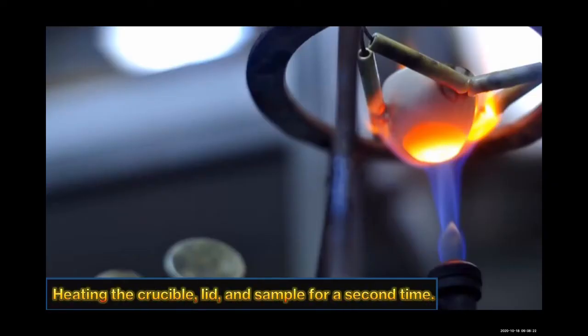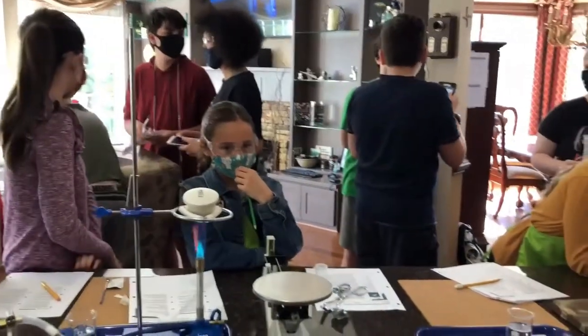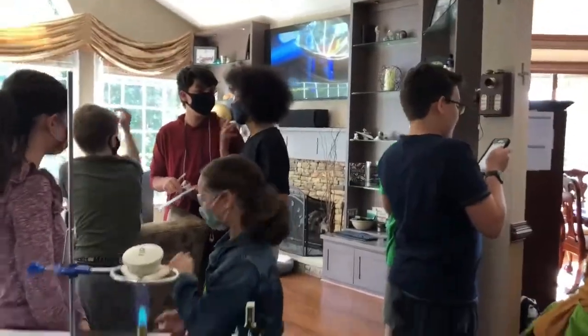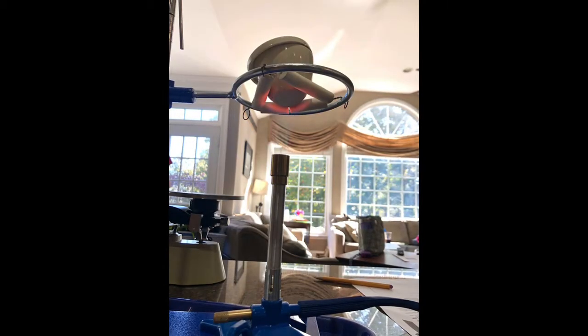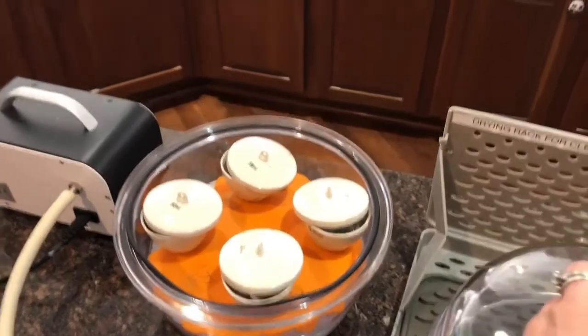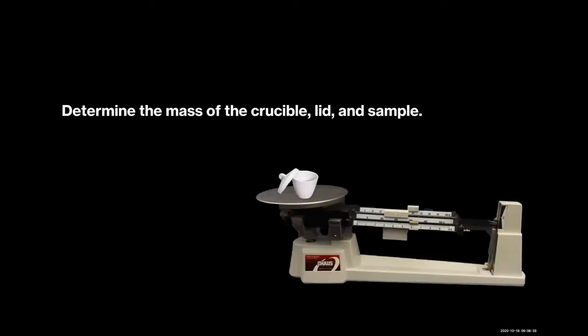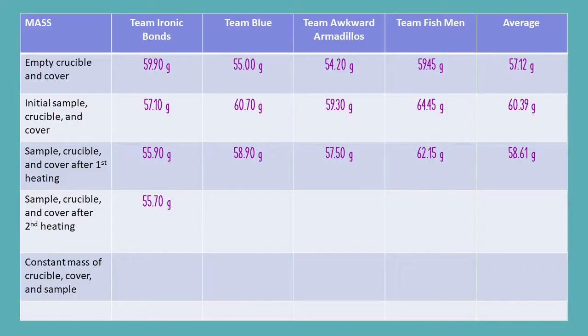Heating the crucible, lid, and sample for a second time. I'm not done yet. Return the crucible and sample to the desiccator for a second time. Determine the mass of the crucible, lid, and sample.